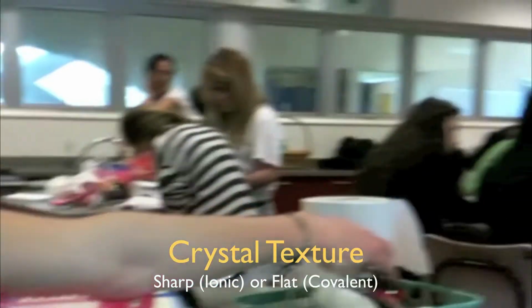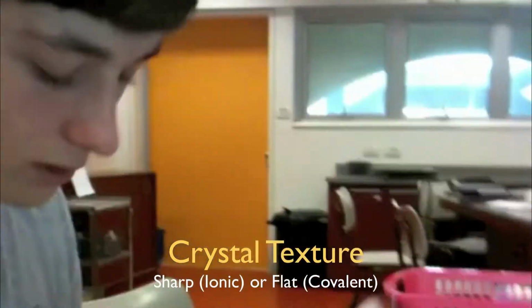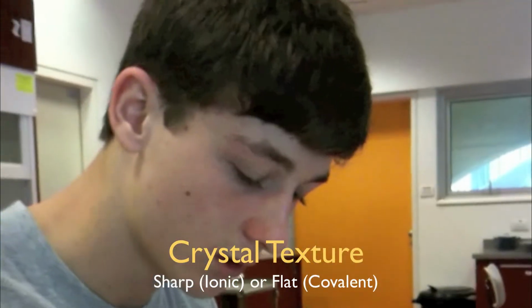Alright, so now we have to test each compound by looking at it through a magnifying glass and then feeling it with the fingers.